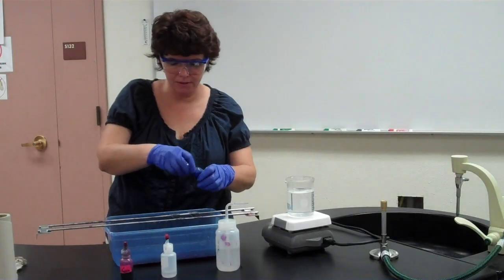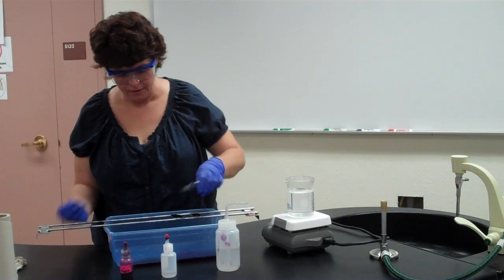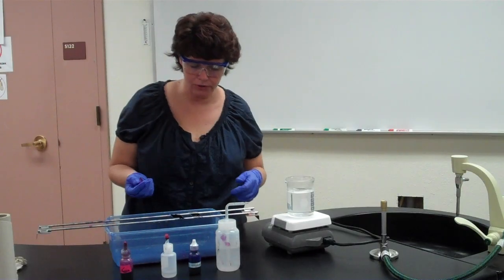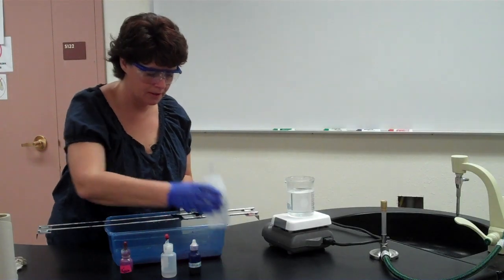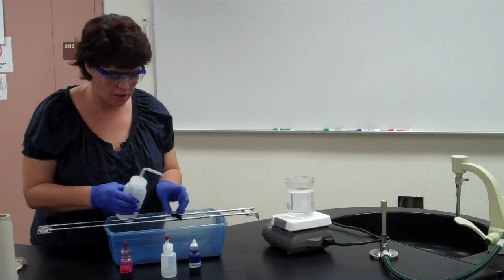In this case, it's methylene blue. So you put that counterstain on for about a minute, 30 to 60 seconds, depending on what your lab procedure says. It just depends on the lab manual which procedure you're going to use. So you let that sit for its time frame. Then you're going to rinse it like we've done in the past. Once again, don't be afraid to rinse it all off.